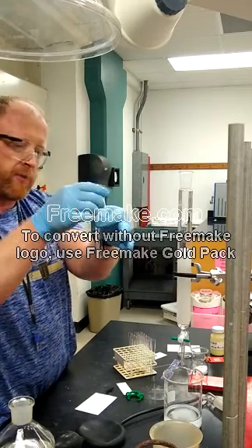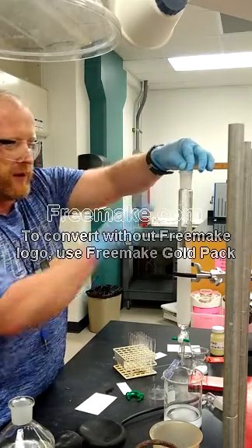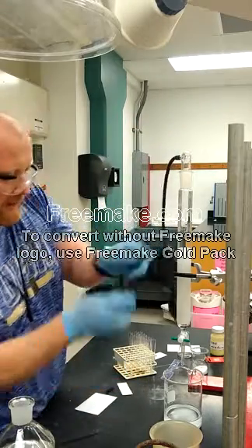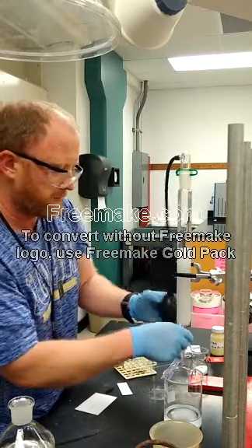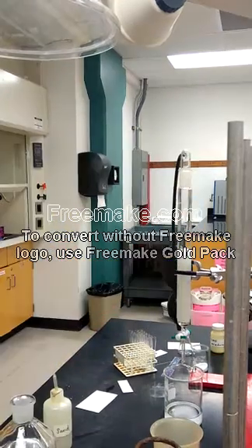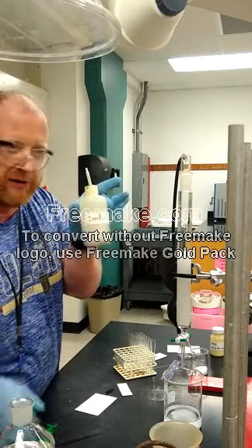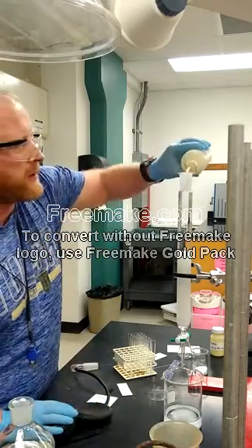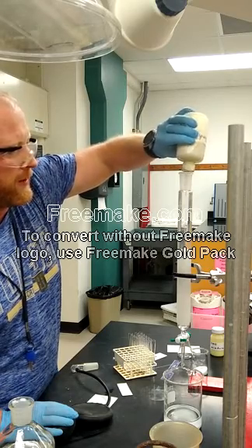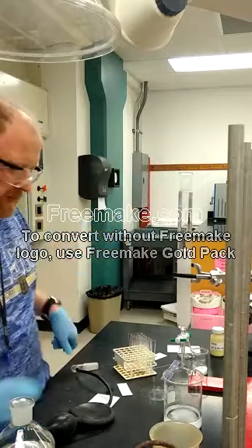You would draw up the dissolved sample with a pipette and try to add it as close to the solvent level as you can, so it's not all over the walls of the column. Then pump it back down to solvent level again. After loading the sample, we put some sand on top — just plain sea sand — putting a layer on top with no exact amount. We just want that to act as a barrier between our sample and the solvent we're about to add.